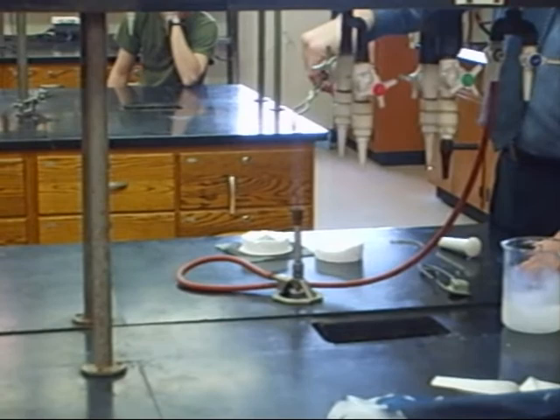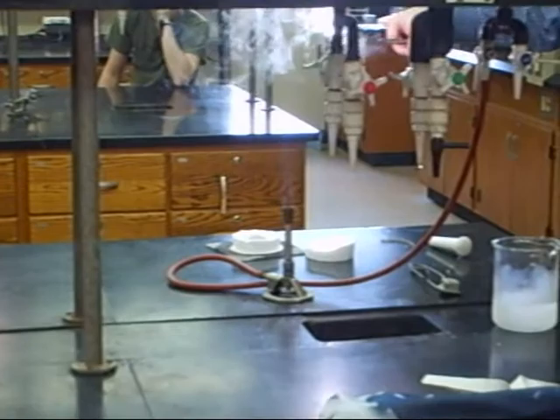Magnesium itself, when magnesium itself burns, it burns with a white, a white glow. Very intense white glow.